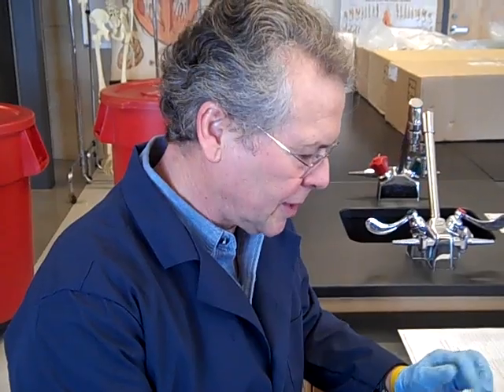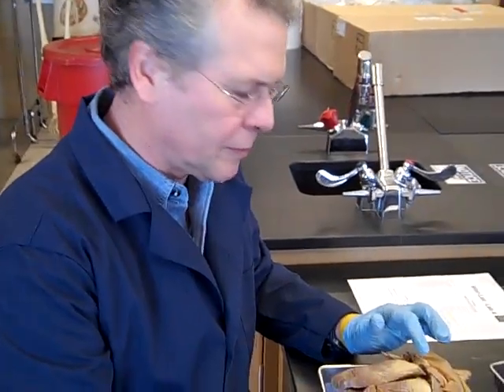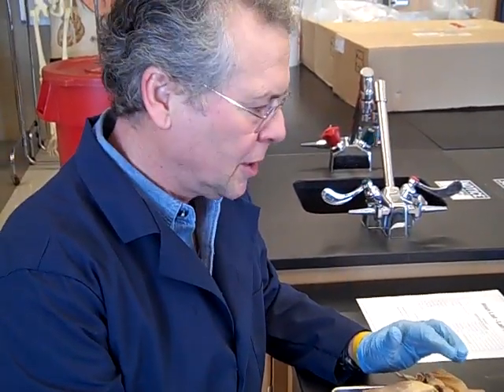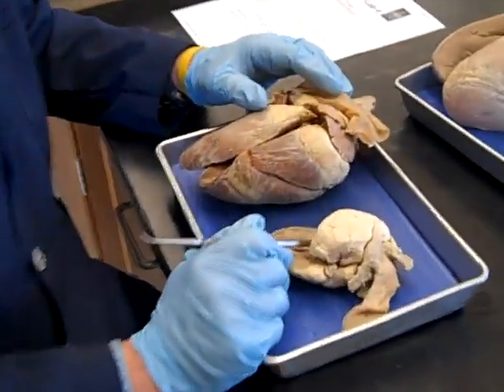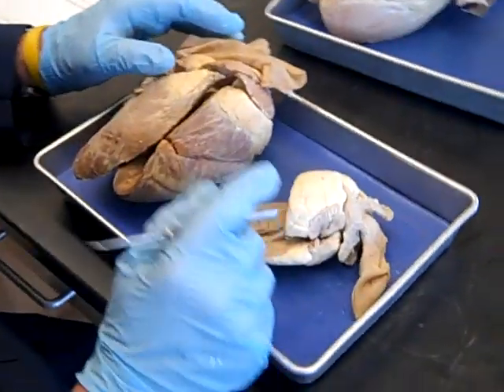This is the second part of the video on the heart. I want to show you a couple of things from some other hearts, and then we'll progress in the flow of blood through the heart.